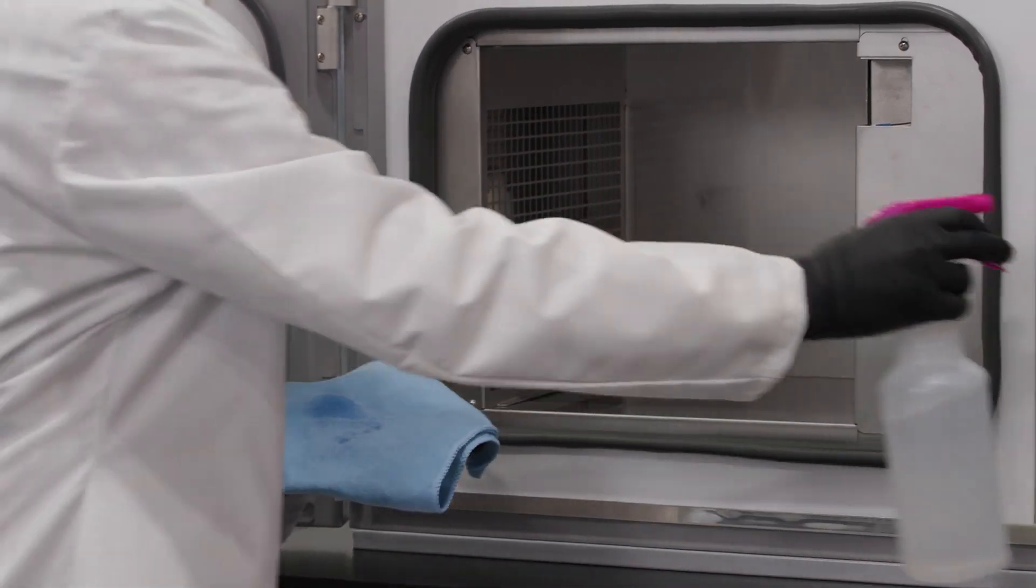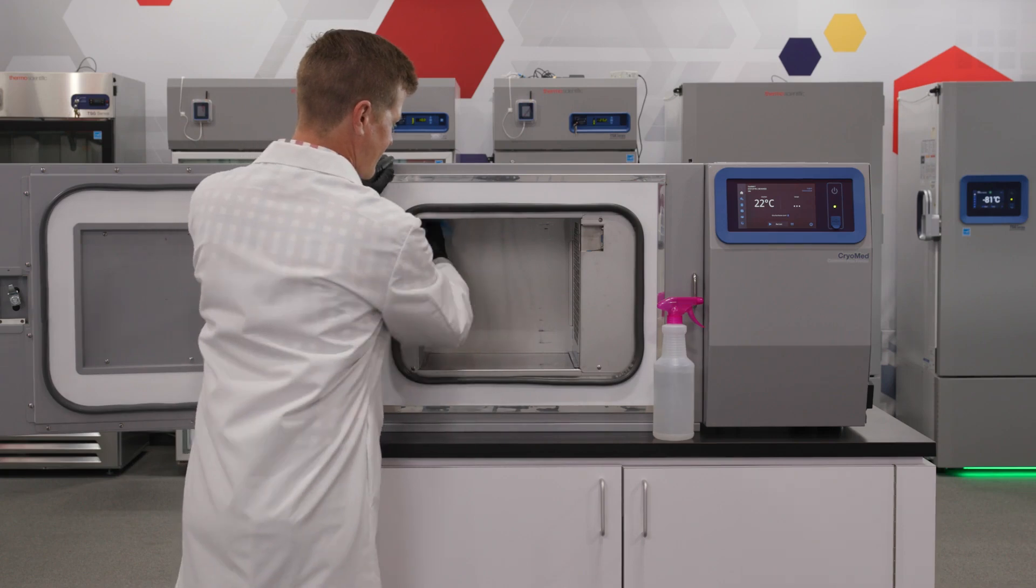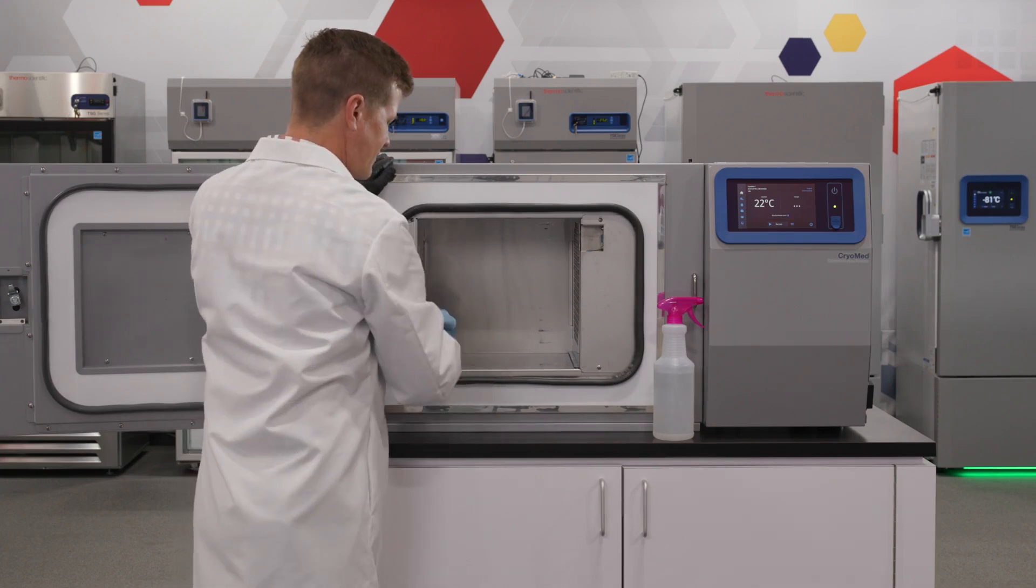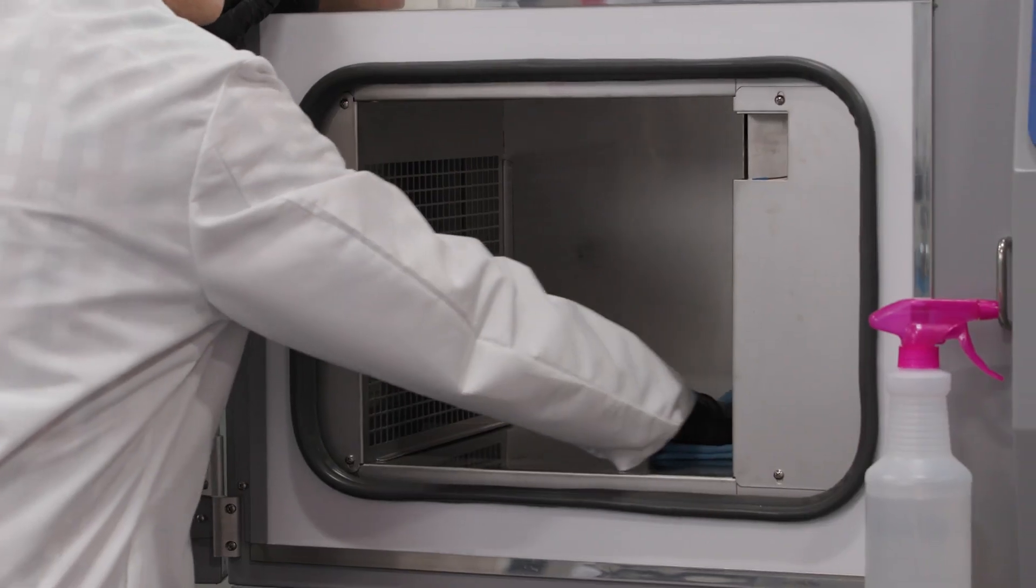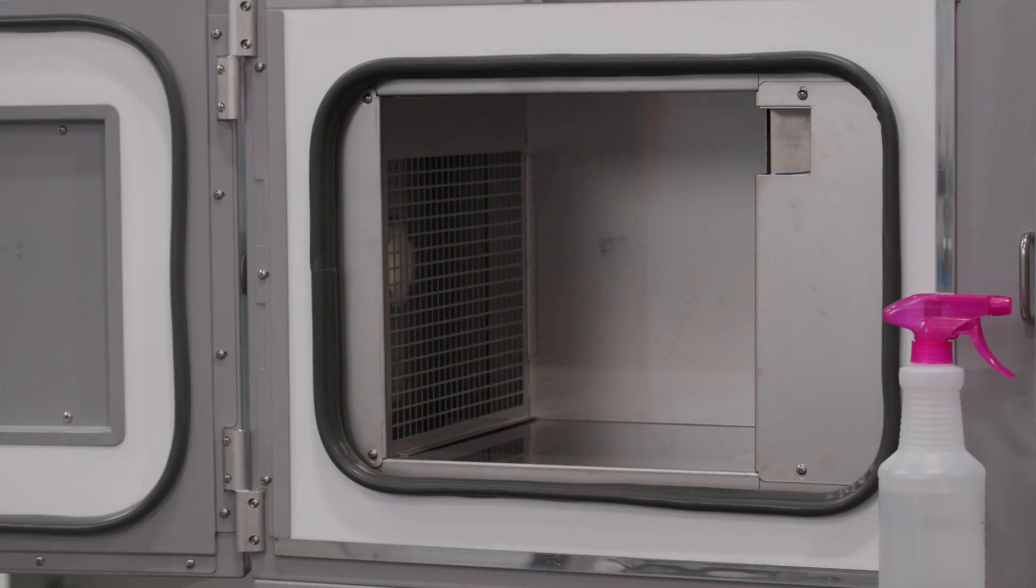Wash the cabinet interior using a non-abrasive cloth and a disinfectant, starting at the top and working down. The cabinet door must be rinsed with sterile water until the disinfectant has been removed. After the cabinet has been rinsed, spray with 70% alcohol. Allow the cabinet door to remain open for the alcohol to evaporate.